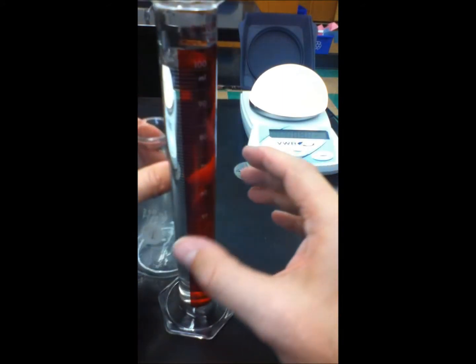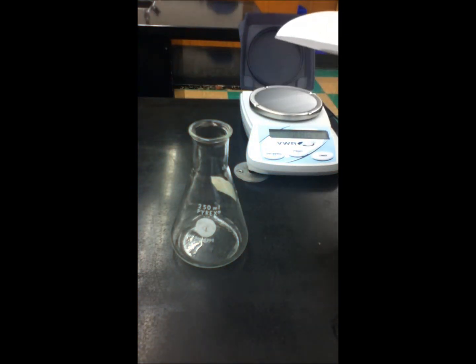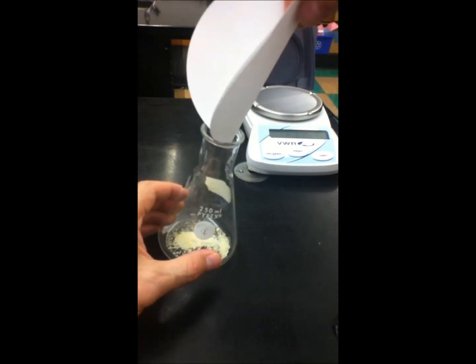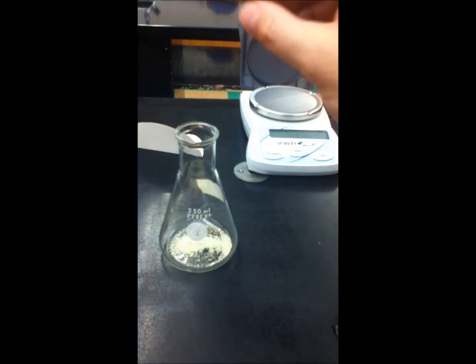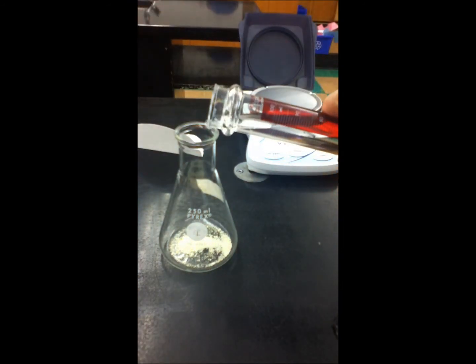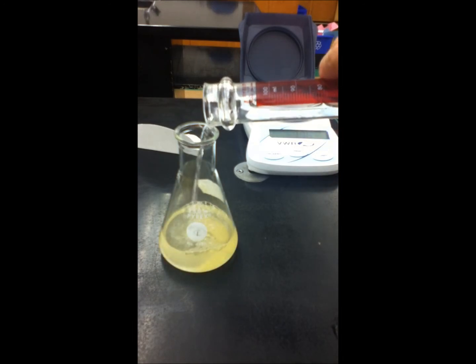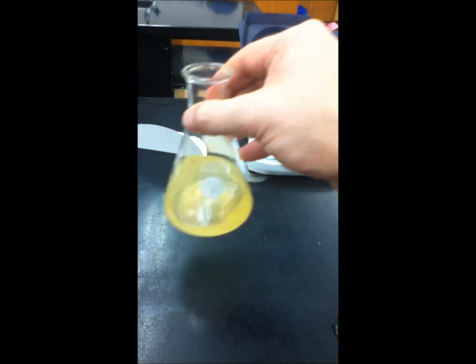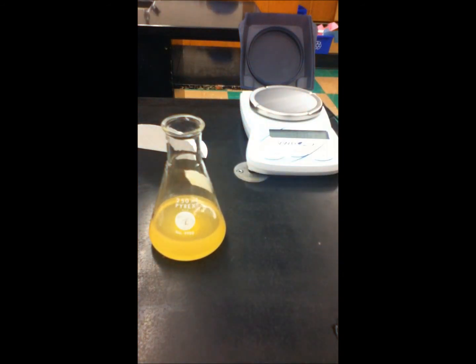We're going to take our 250 milliliter flask. Let's put the iron sulfate powder in first — you can see how folding that paper is useful there. Now we're just going to pour our water in on top of that and get it to dissolve. We'll swirl it to get it to dissolve and come back for a second video to do further comparisons.